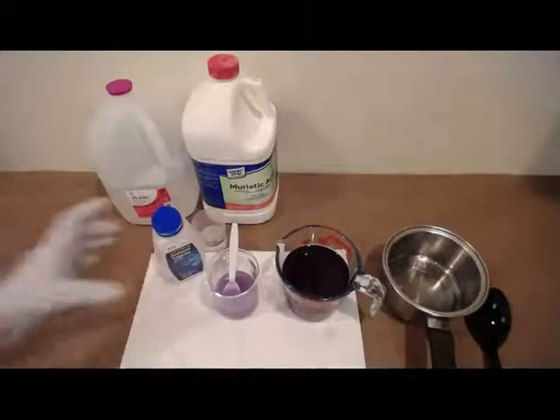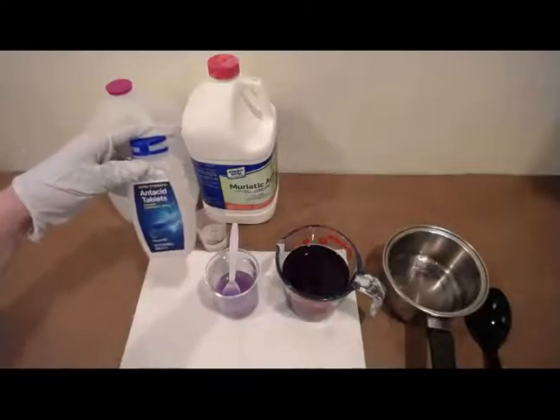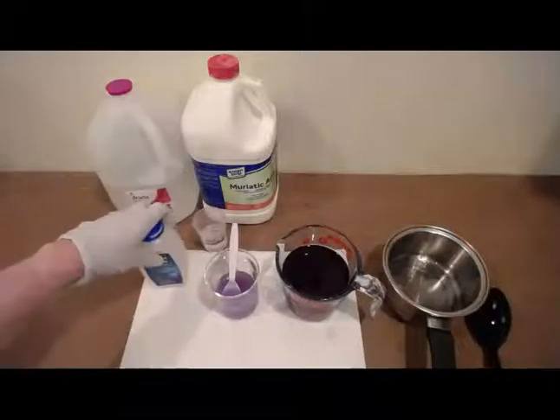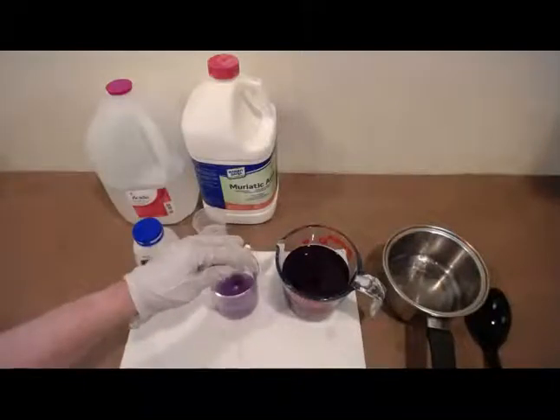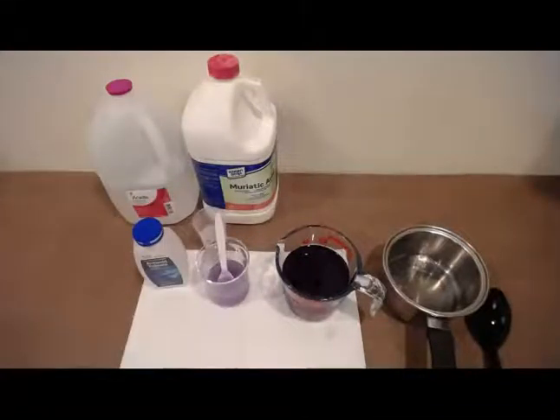So again, we're learning about the digestive system, and your stomach has hydrochloric acid in it. That's part of the digestion process, how it digests the food. But sometimes you get just too much acid going on in your stomach and it becomes very uncomfortable, which is why people will take antacid, which is calcium carbonate in this case, and it has now neutralized that acid. So a person who takes an antacid tablet won't be quite so uncomfortable. Okay, go ahead and take a moment to write down the results that you observed there.